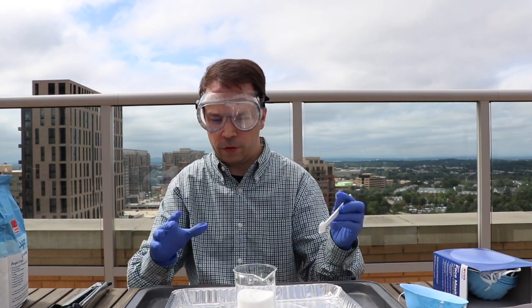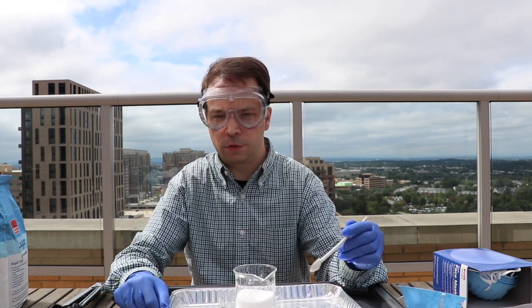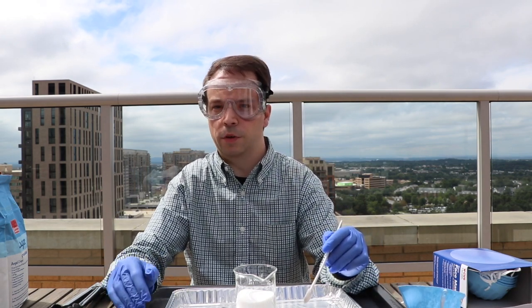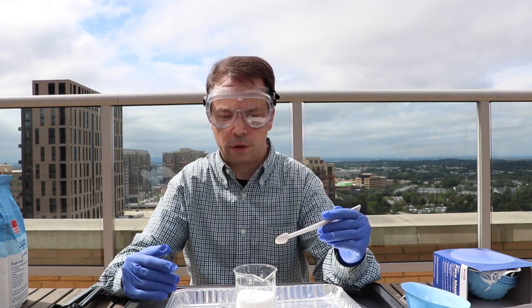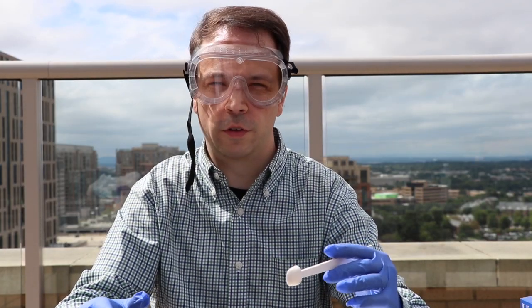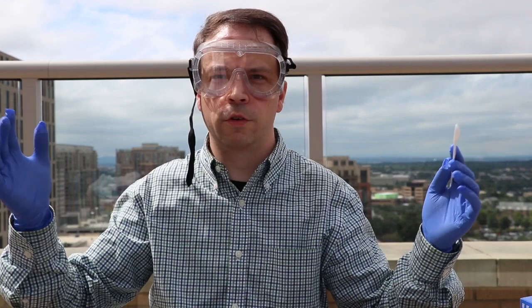If you're looking at that formula, when you have H22 and O11, think about possibly a common denominator there. So you can actually, by pouring sulfuric acid in there, take out the H22O11, which really, boiled down, is water, H2O. So what we're left with is just pure carbon. During the reaction, the sulfur will also bond with oxygen to create sulfur dioxide gas, which in higher quantities is pretty toxic. So we want to do this outdoors.